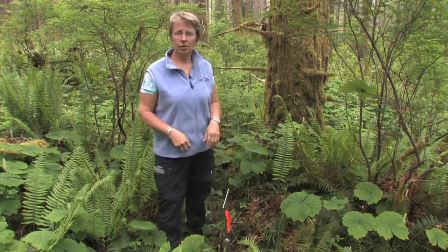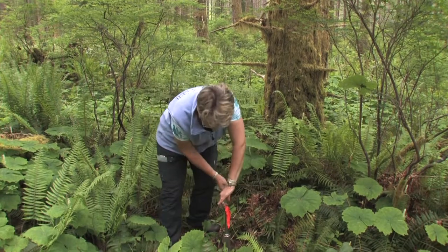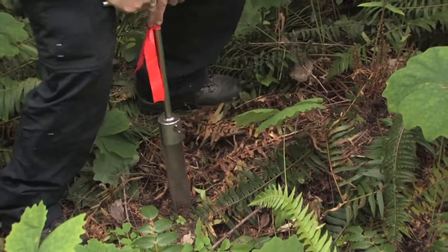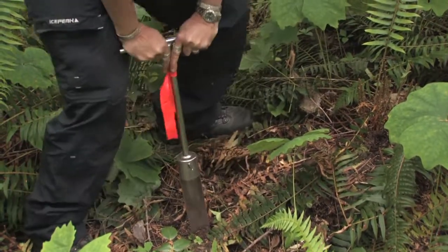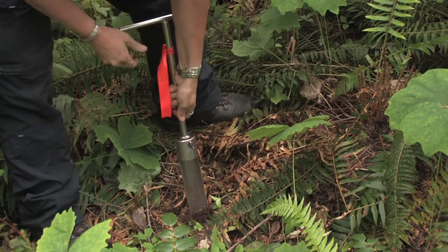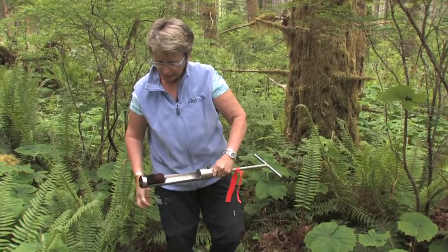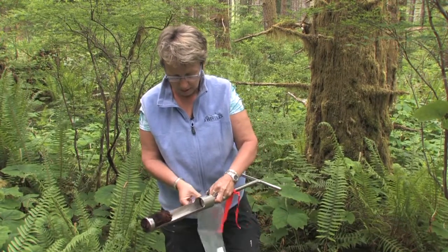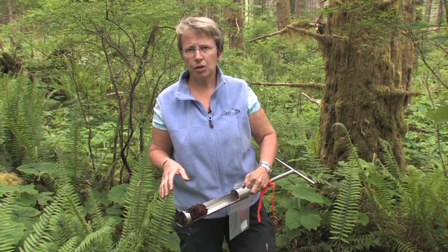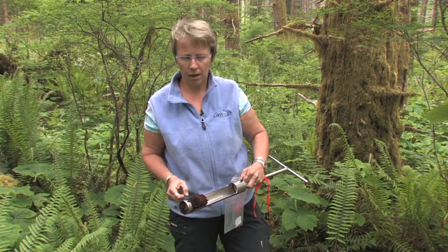I'm going to show you how we take our samples for the soil mesofauna. In this case, we take soil cores. I'm just going to take a core of soil — the whole of the LFH horizon including the top three centimeters of mineral soil. We take this core, just into the mineral layer, and then bag this sample up. We want this core to remain intact because we're going to use a funnel extraction method to get the soil mesofauna out for analysis.